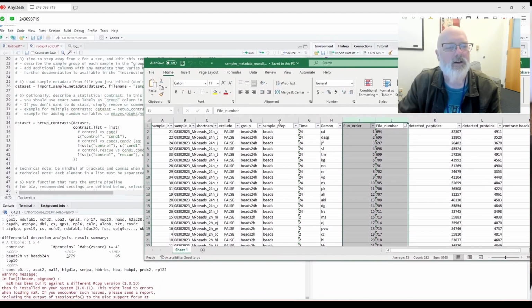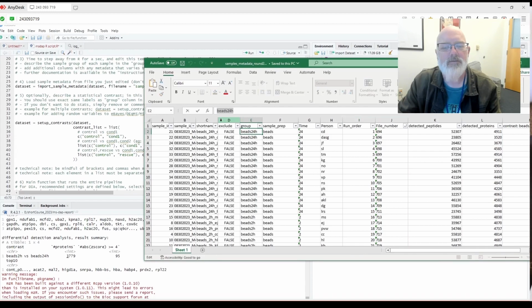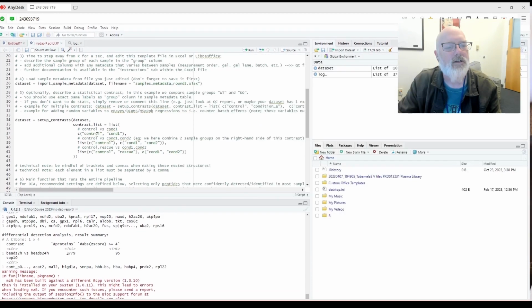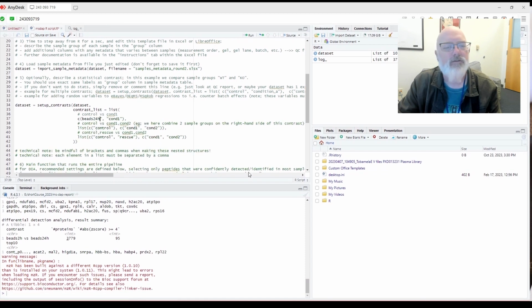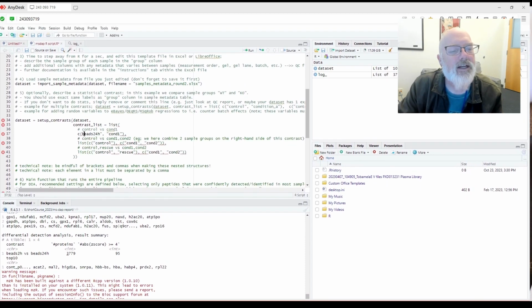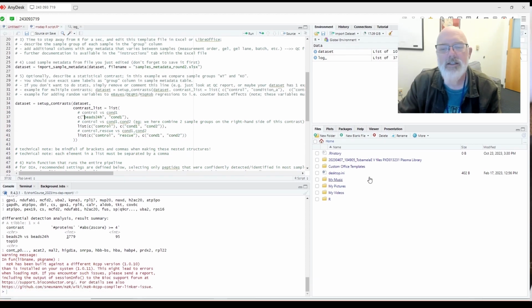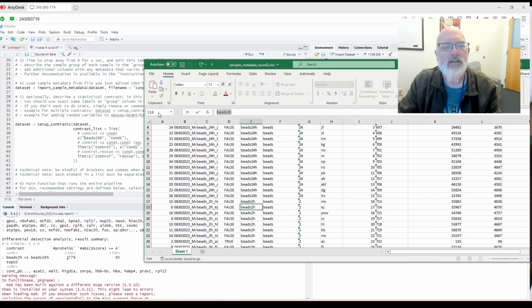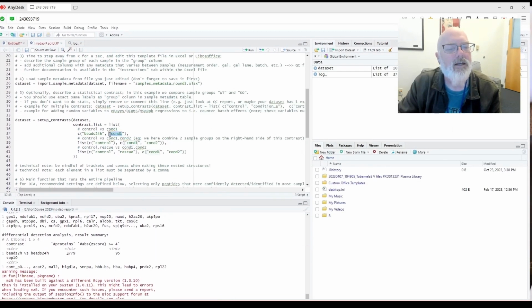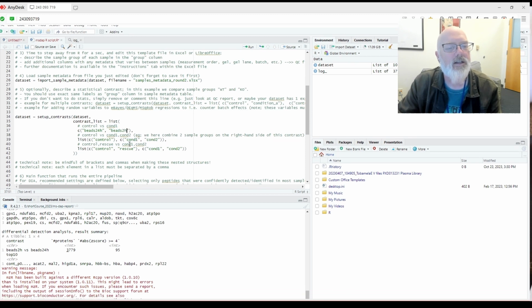And if we spell them wrong, it'll fail. So remember, this would be in the groups. So that would be, we could do the beads 24. Oh, and remember, they have to have quotations. Don't forget the quotations. And we could do beads 2 hours. So this would be the same beads 24 versus 2 hours, but with the excluded ones.